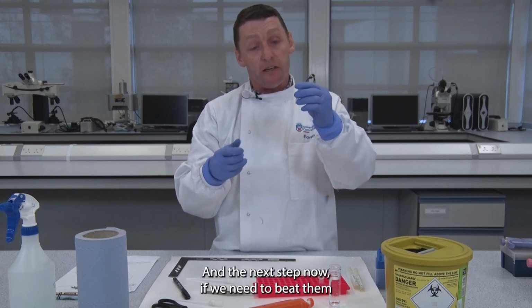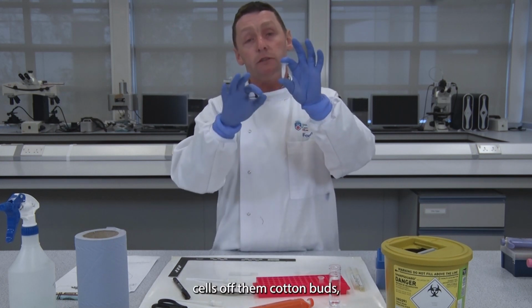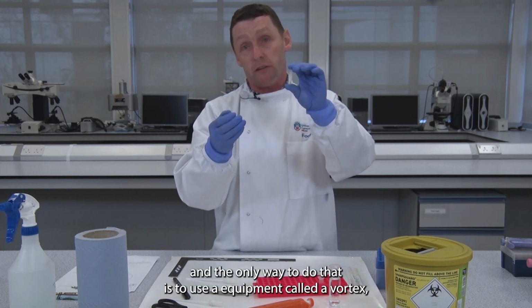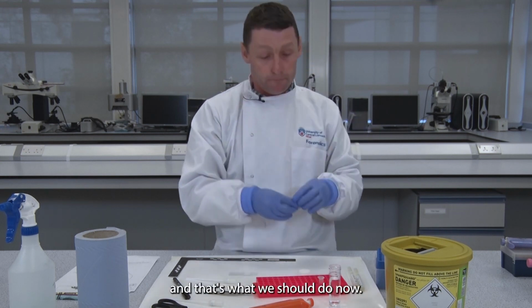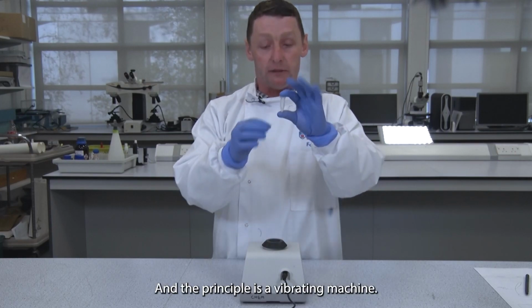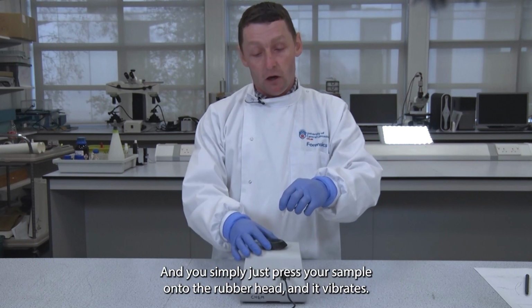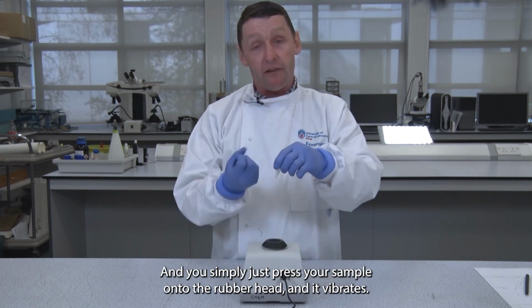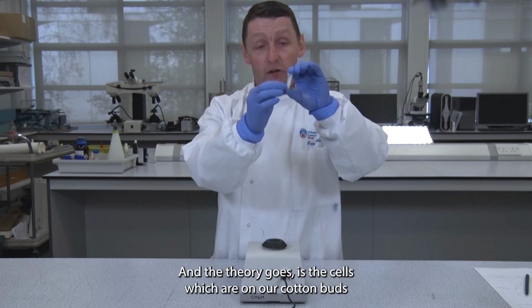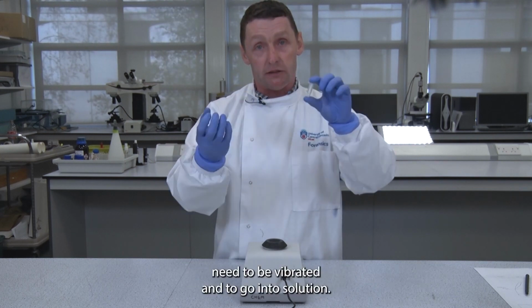And the next step now, we need to beat the cells off the cotton buds, and the only way to do that is to use equipment called a vortexer, and that's what we should do now. The principle is it's a vibrating machine, and you simply press your sample onto this rubber head and it vibrates, and the theory goes is the cells which are on our cotton buds need to be vibrated and to go into solution.